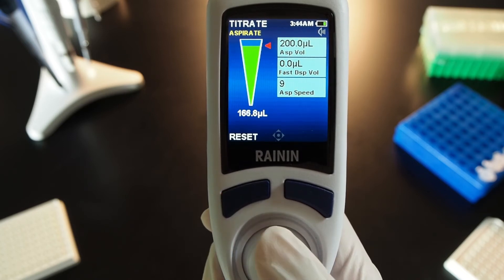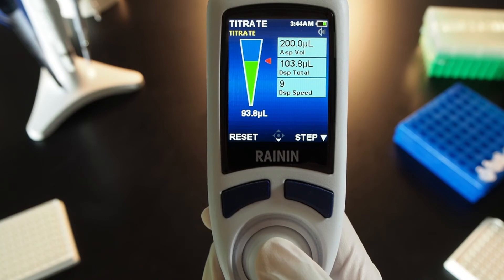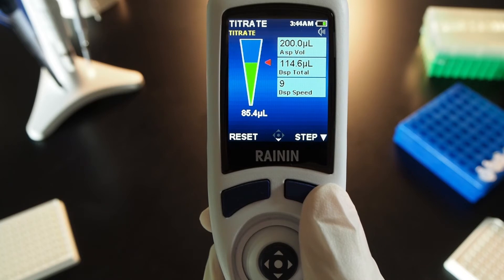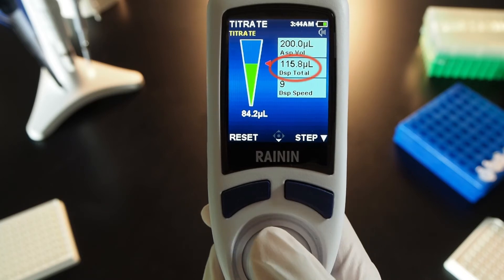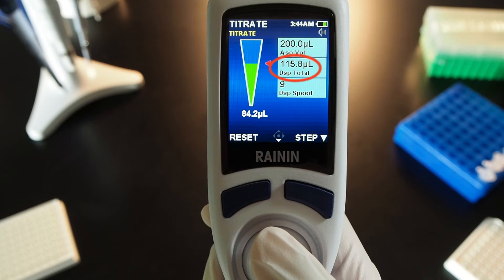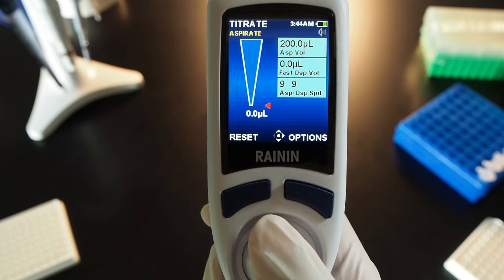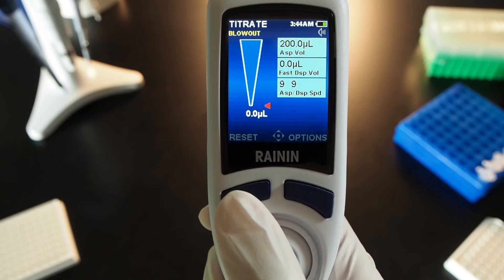Joystick up to aspirate and hold the joystick down to dispense. To dispense in small increments of 2 tenths of a microliter, press step in the lower right. Your titration volume is tracked in the center box — dispense total.